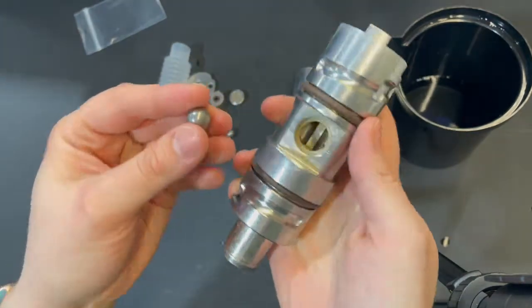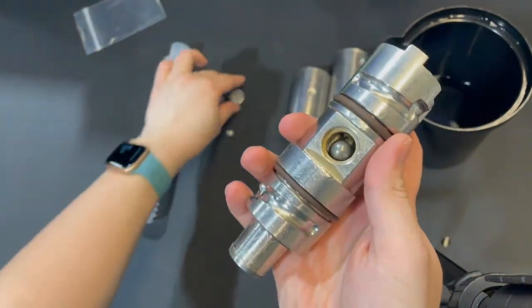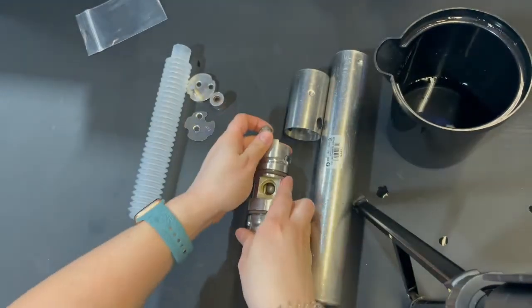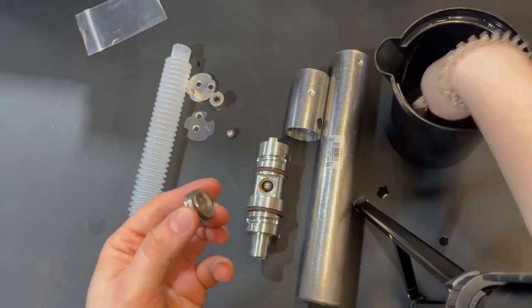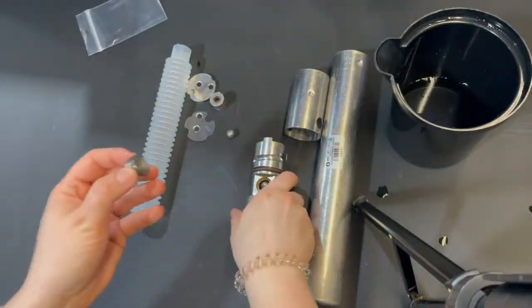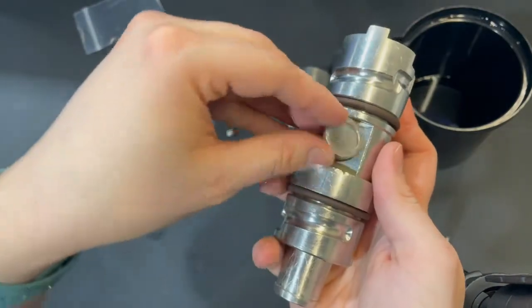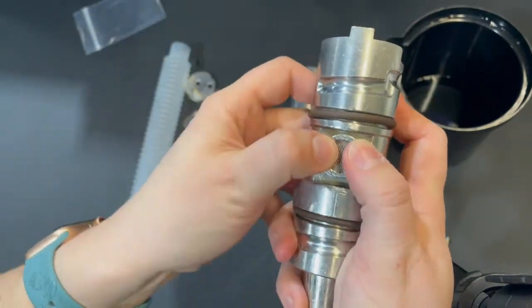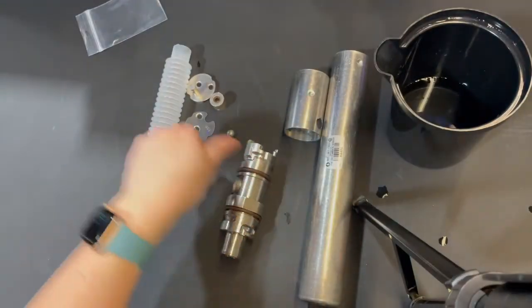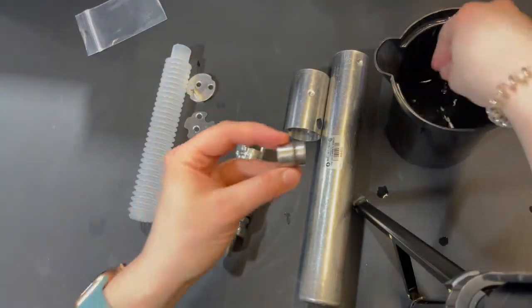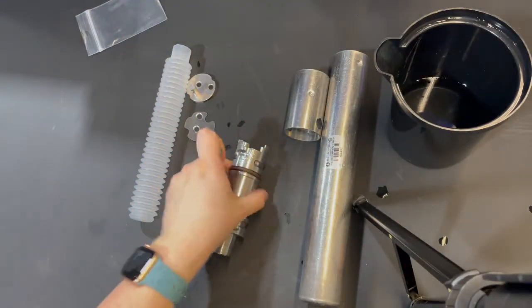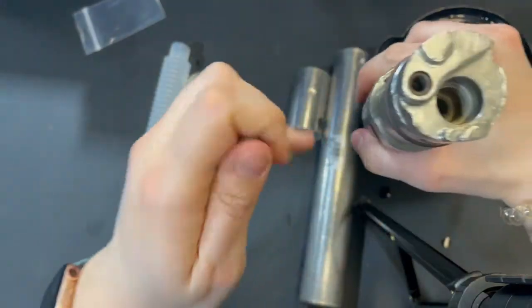Next, we're going to take one of the small metal balls and insert it in the side. This is where the screen cover is going to go on. You want to put the side that has the o-ring into the actual hole where the ball is. You can use a bit of water to wet the o-ring just to make it easier to fit in there. You should feel it snap shut. The o-ring should be non-visible and it should be fitting in there snugly. If you want to wet the o-rings with a little bit of water, that's fine. It helps them go in a little more easily.